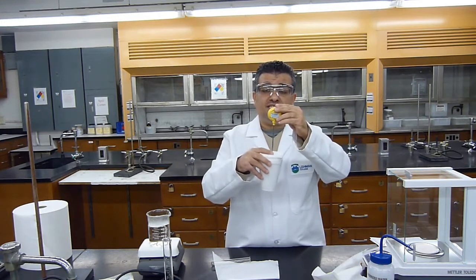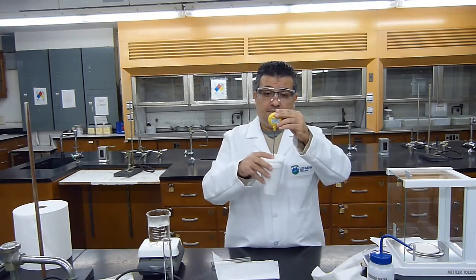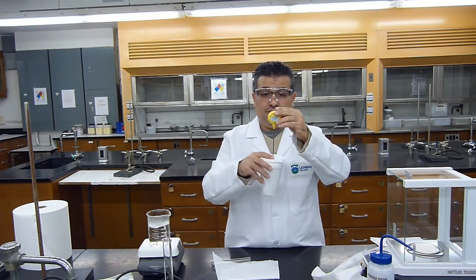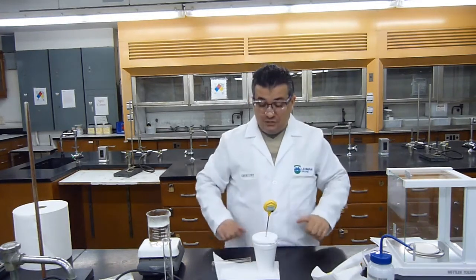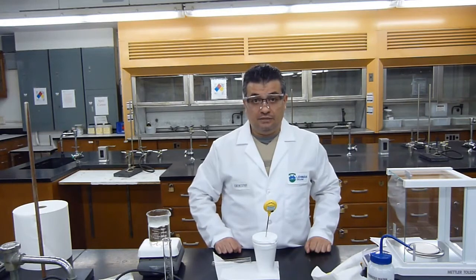I will wait to see if it goes up to 32.9 or if it goes down to 32.7. I'm looking for the maximum temperature, and now it seems that it went down to 32.7, so I will record my maximum temperature, my equilibrium temperature, at 32.8 degrees Celsius.